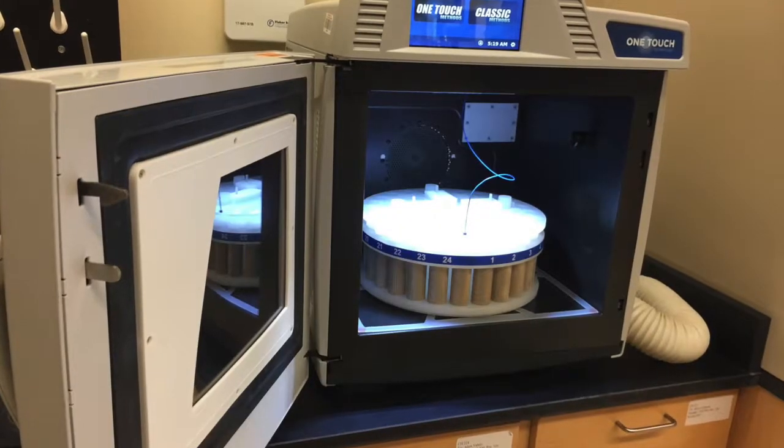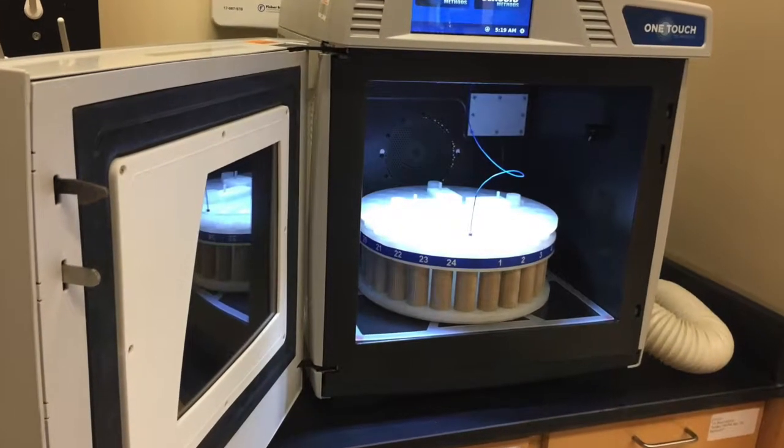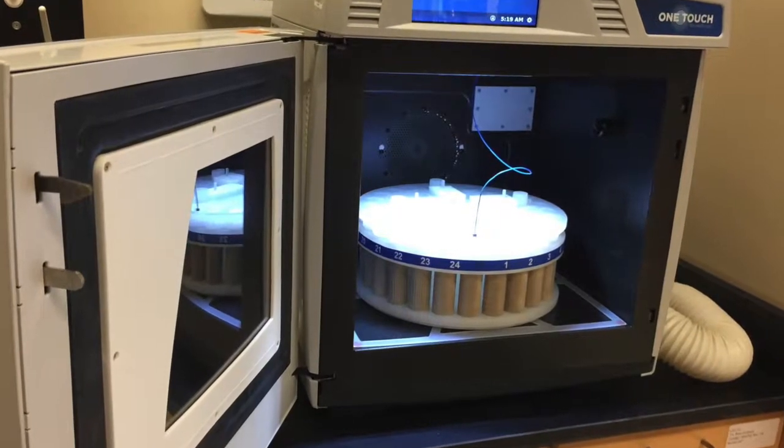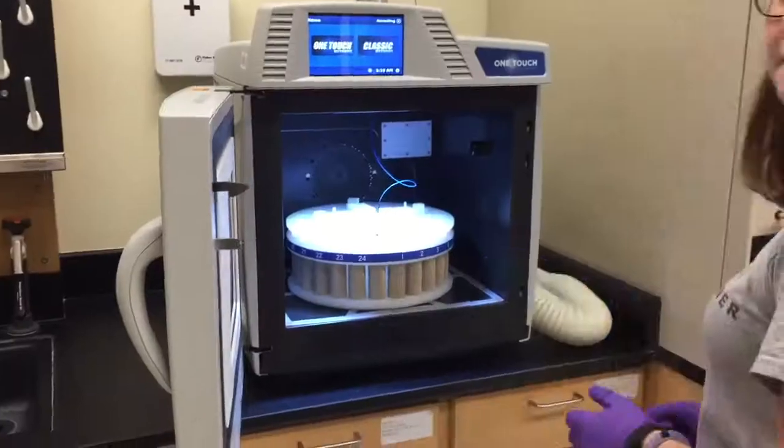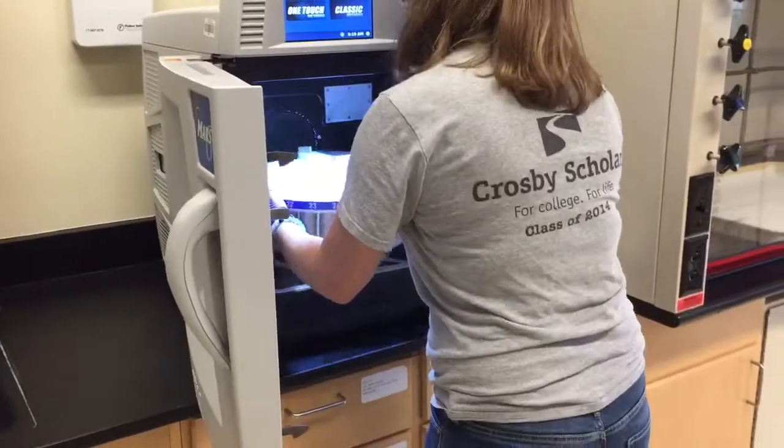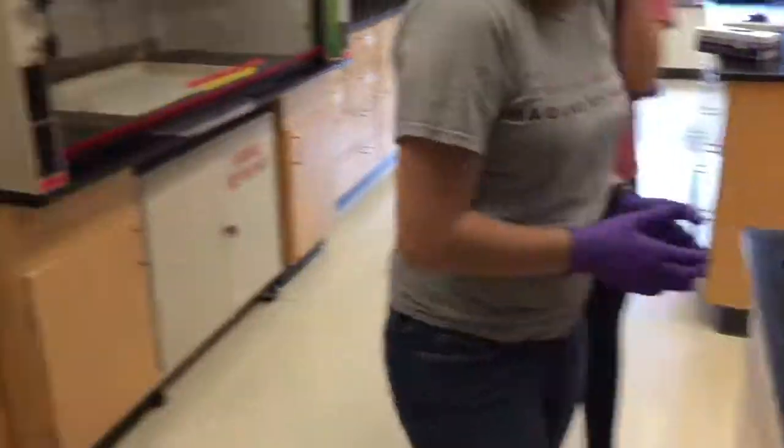When the microwave heating method is completed, allow the vessels to cool below 50 degrees Celsius before removing the vessels. Remove the fiber optic probe from the control vessel and carefully remove the turntable.